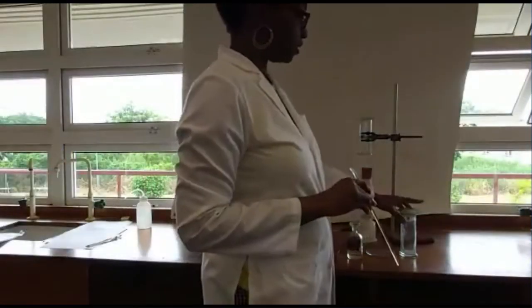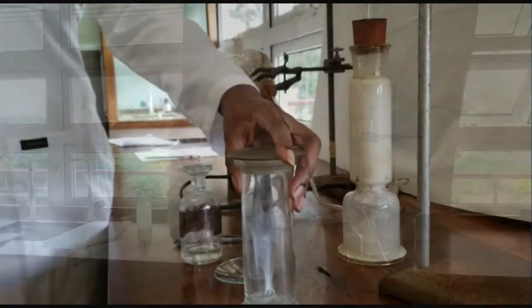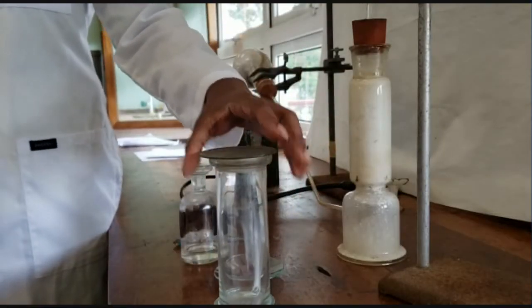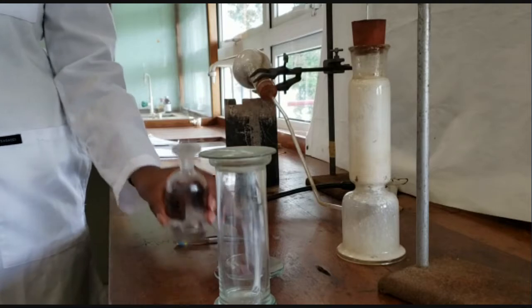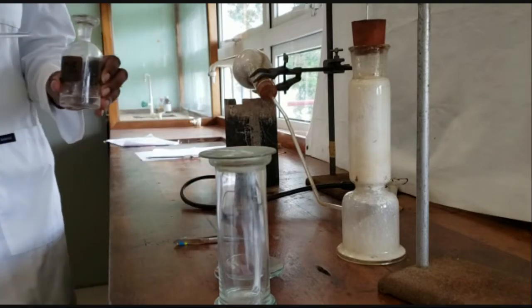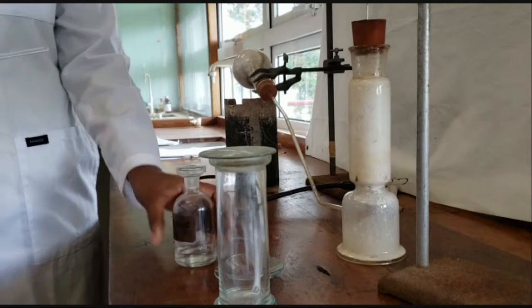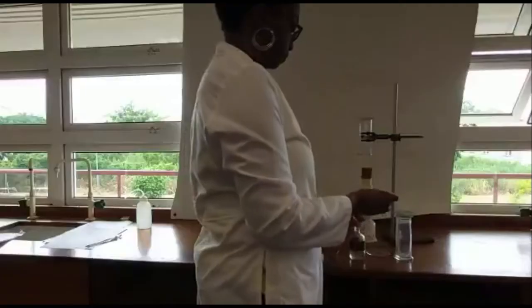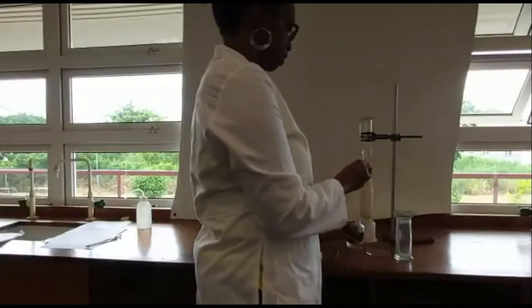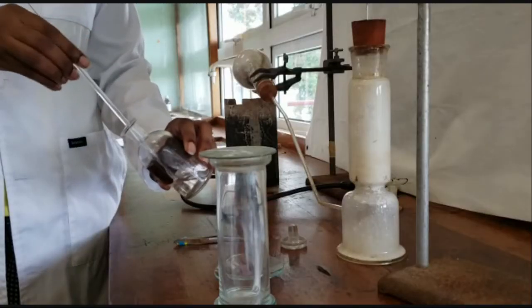We've collected this glass jar full of ammonia and we're going to run a confirmatory test. We're going to use concentrated hydrochloric acid to generate hydrochloric gas. It's fuming already — here's our glass rod.